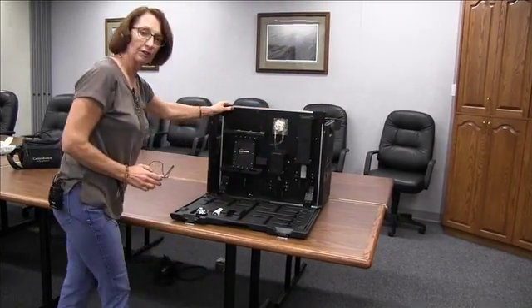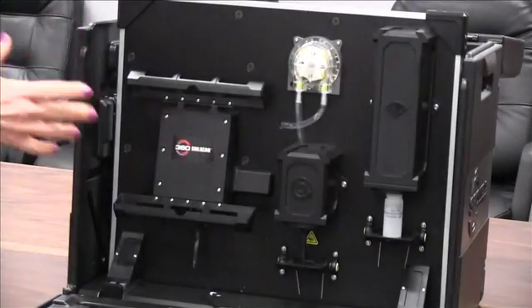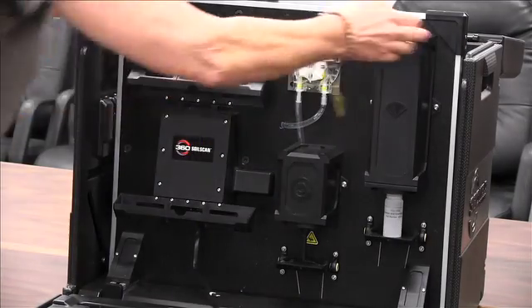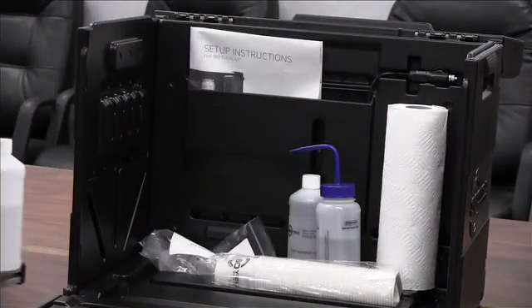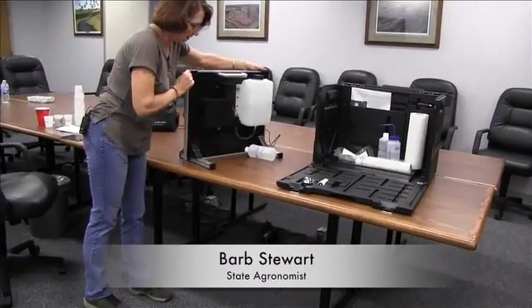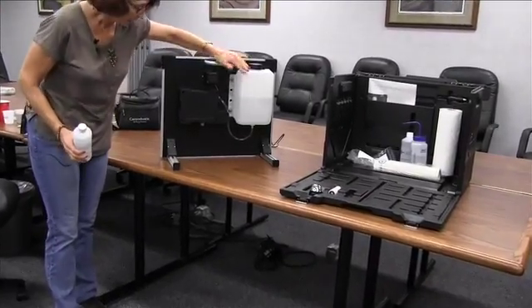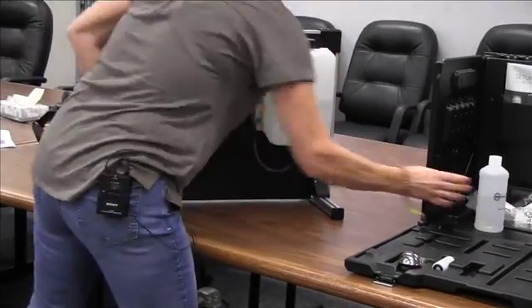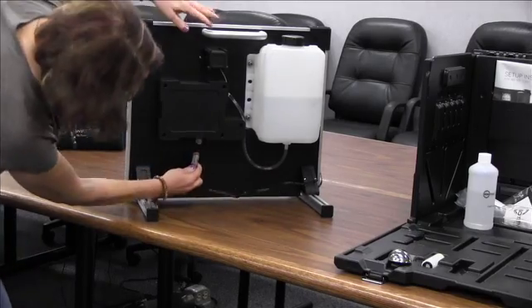The 360 soil scan unit can be utilized right in the box or for convenience. We're going to take it out so we can show you exactly where to put the power plug in. It is a fully self-contained unit. With it comes the distilled water solution, and back here is where the plug-in is. We are going to go ahead and demonstrate plugging the unit in.